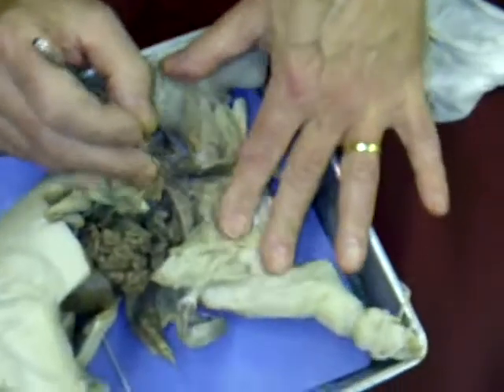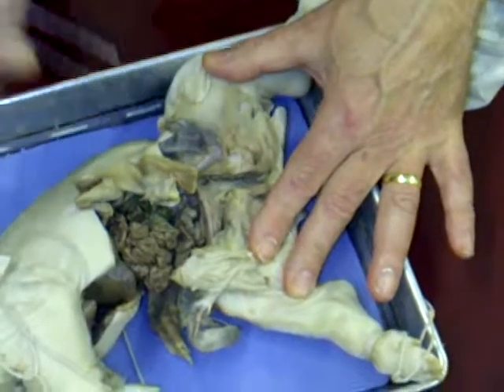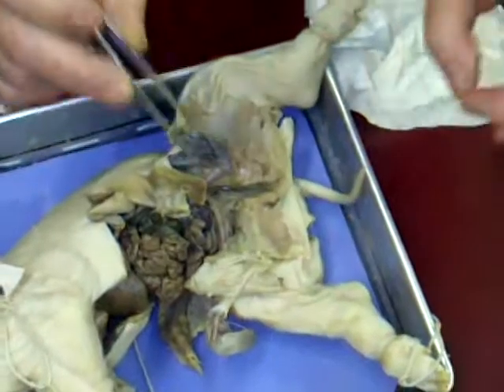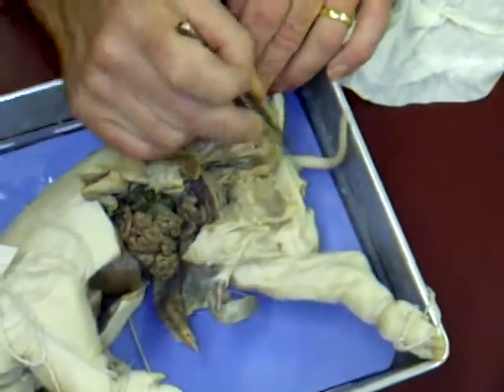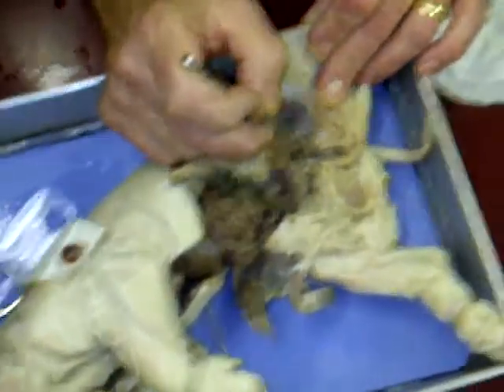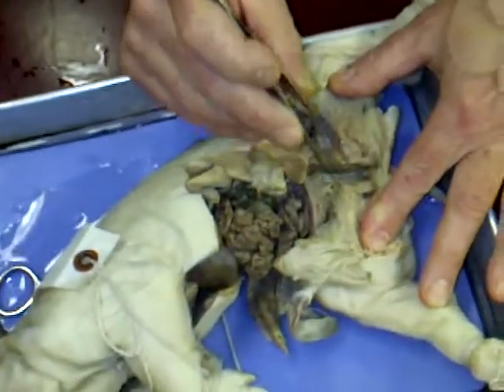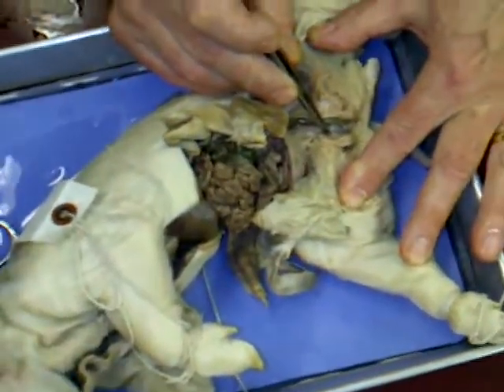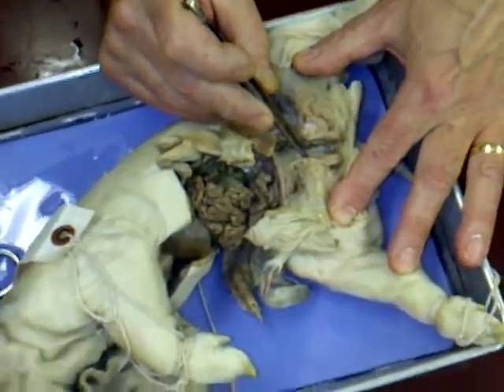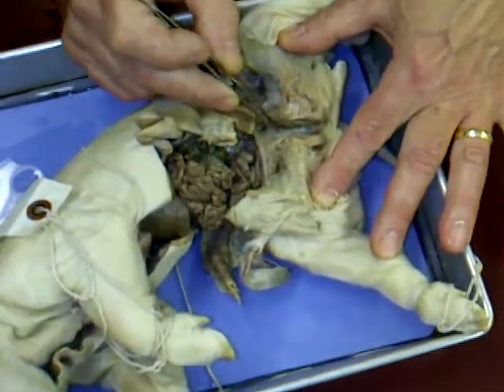All I'm saying is that in that order, going from front to back and also from cephalic to caudal, it's urethra, vagina, colon. And that's the same order of the openings. Now the thing is here, you won't find three openings in the fetal pig. You only find two. You find the opening to the colon, and then you find what's called a common urogenital opening, because you see the urethra and the vagina come together about 2 centimeters from the bottom. That's because they don't separate until shortly before birth. They gradually separate.